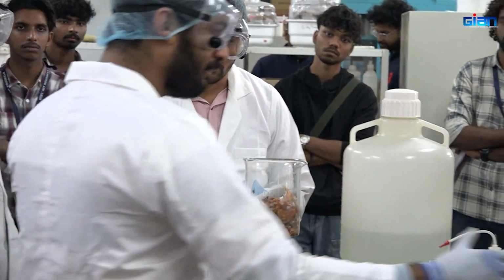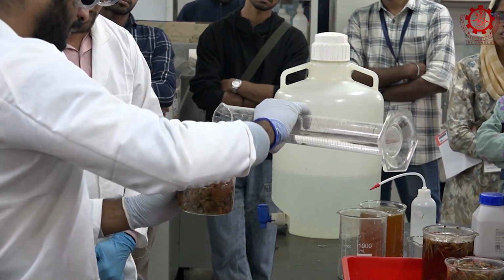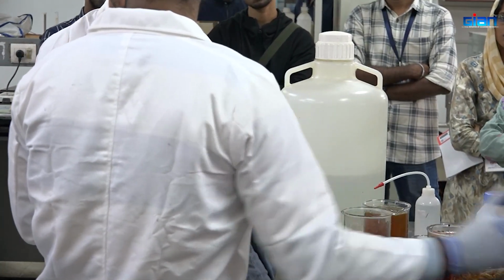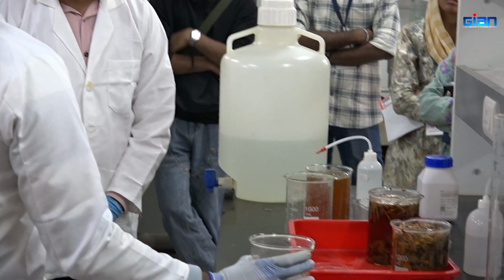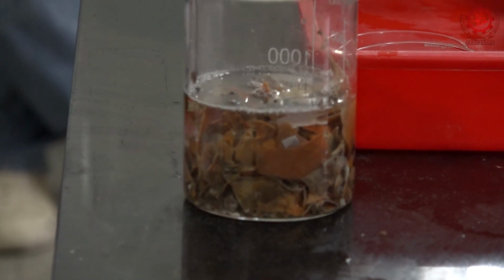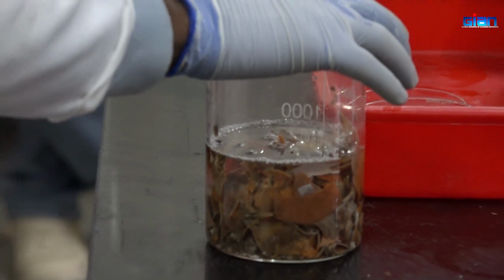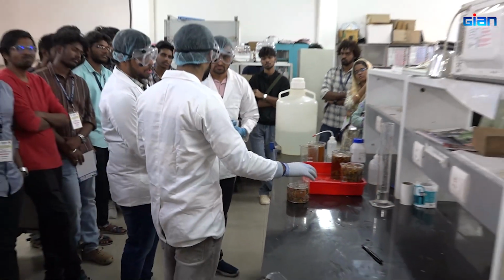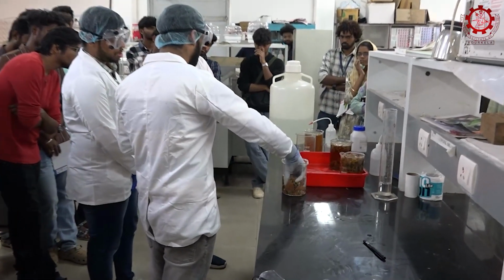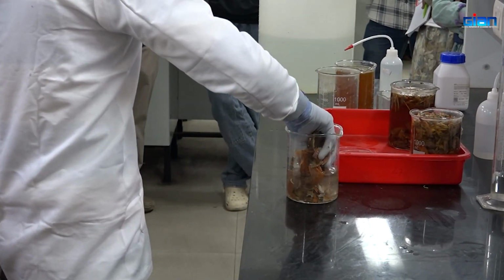Anyway, about how we can wash it: during washing, if we directly wash with normal water and just throw it, it doesn't remove all the dissolved matrix or dissolved acids. So we have to mix it properly and keep it for some time. If we heat slowly, the acid fraction can be easily separated out. We mix it properly and remove the other debris attached to the shells.